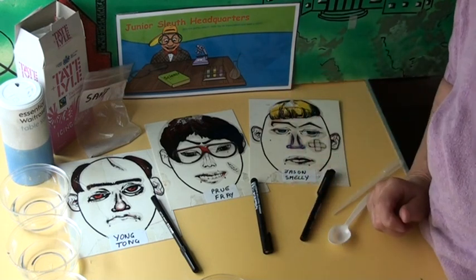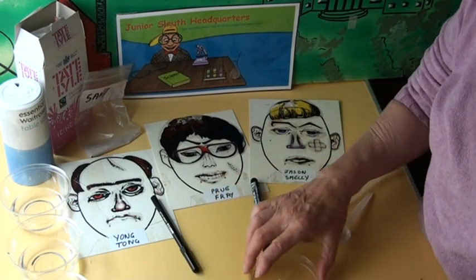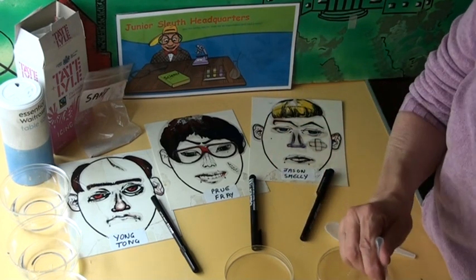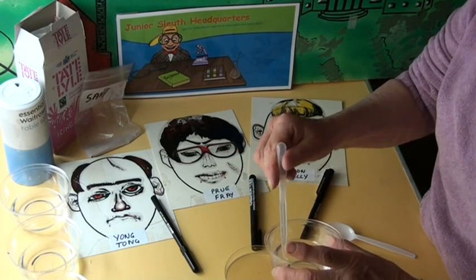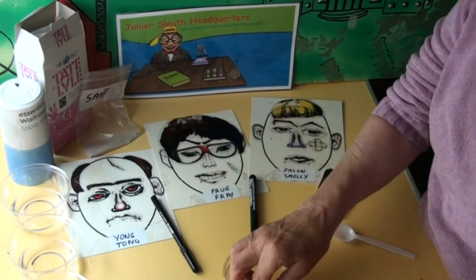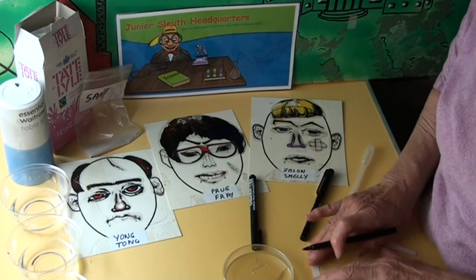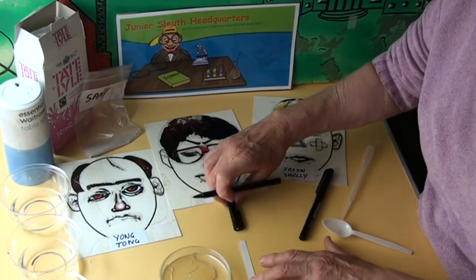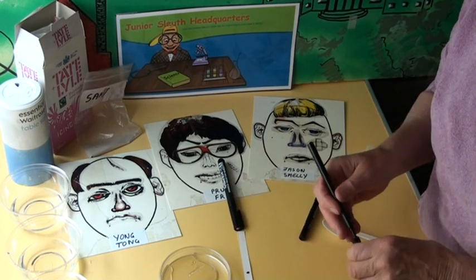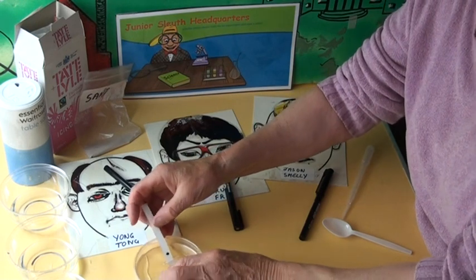We've got to find out which of those pens wrote that note, and to do this we're using the science of chromatography. Let me show you how. First of all, we take a petri dish with a slit in the lid. We put three measures of water into the first petri dish. We take a strip of chromatography paper. Take Yong Tong's pen and put two fingers at the base of the pen. Measurement is very important in science. Two fingers from the base, we put a big inky dot from Yong Tong's pen.